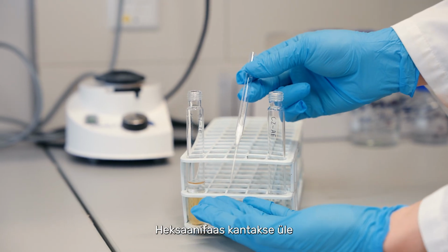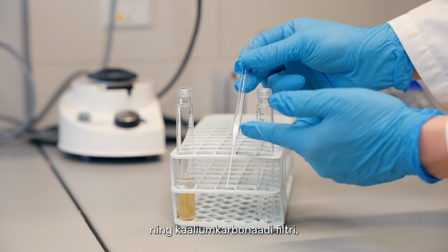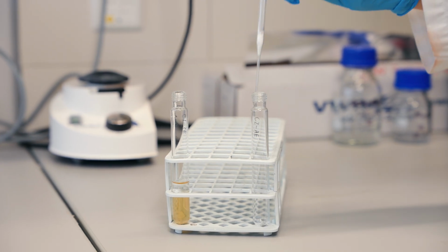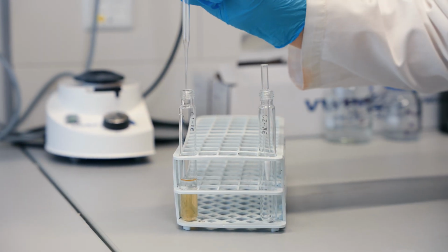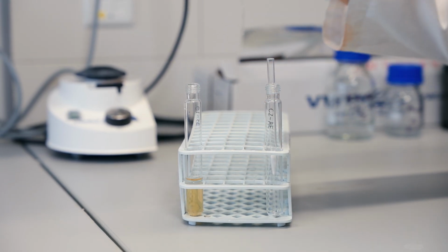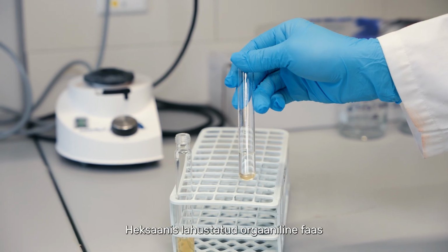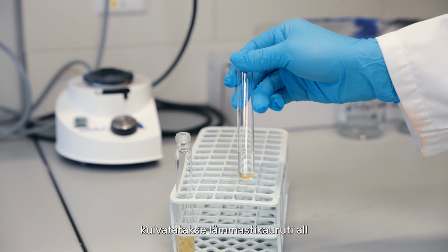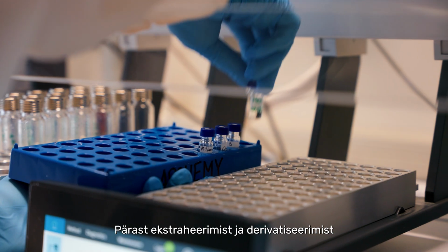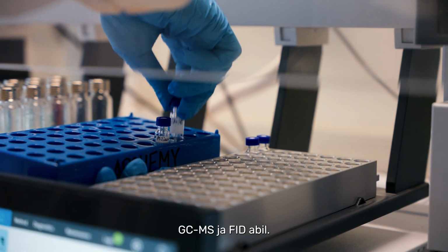The hexane phase will be transferred and filtered through the glass wool and potassium carbonate to remove the acid and aqueous phase. The organic phase dissolved in hexane will be dried down under nitrogen and then reconstituted with hexane into the GC vial. After extraction and derivatization, the samples will be analyzed with GCMS and FID.